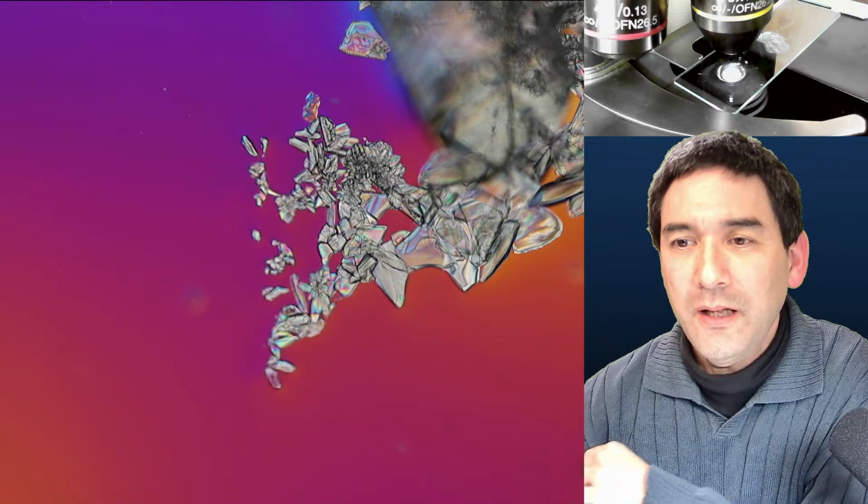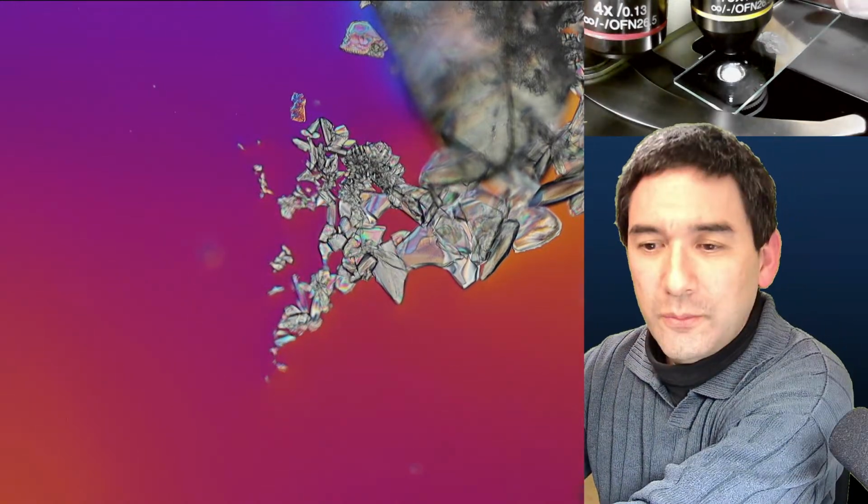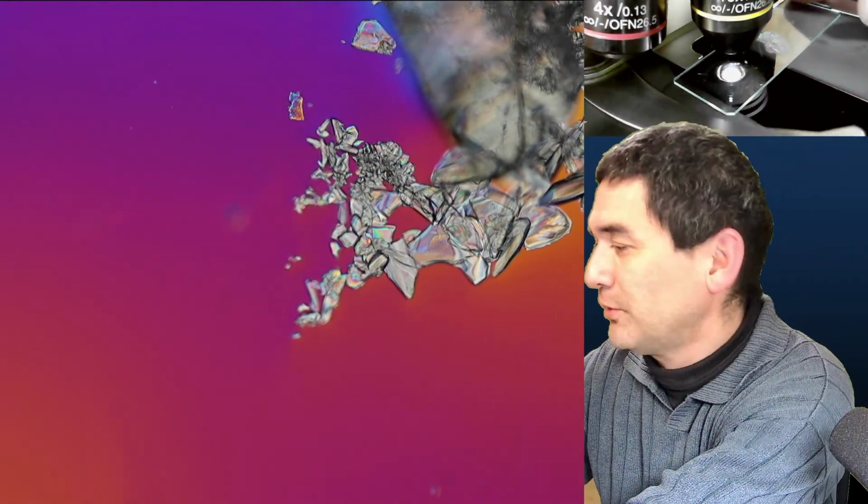So, okay. Let's move on a little bit. What time is it? Oh, it's almost 1 hour already. So this is number 5. Number 6, I quickly go through the others. Number 6 was the one that I made before. It was the alum. Number 7. What's number 7? That's a cool one. Number 7 is urea.